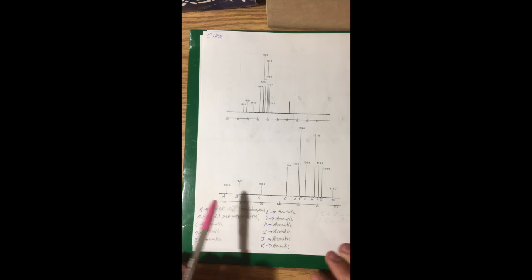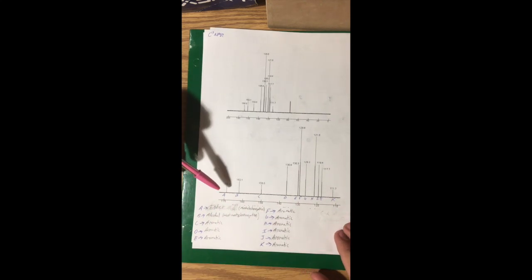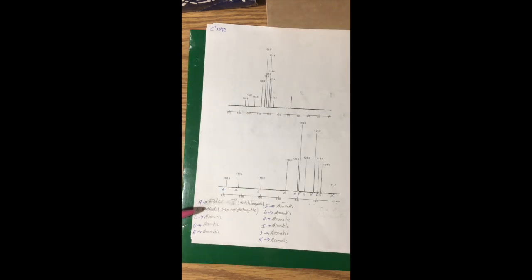As we move into the carbon-13 NMR here, I worked it from the most electronegative at A to the least electronegative at K. So if we start with the most electronegative, we see that's an ester. It's due to the 2 oxygens coming off of it here, so that's A right there. So we look at B, here at 162, that signifies that it's an alcohol. And this is the next most electronegative, so B right here, that carbon going to the alcohol.